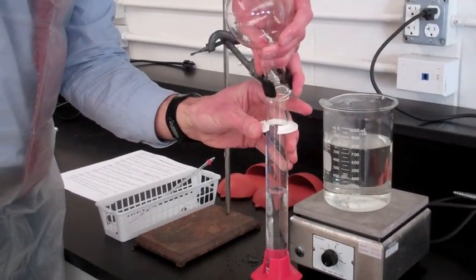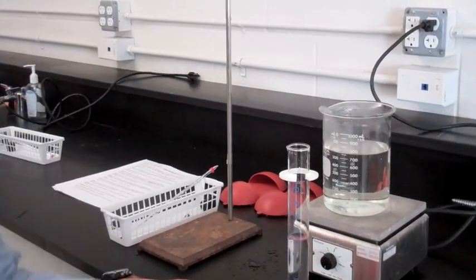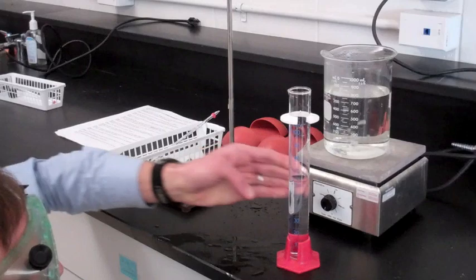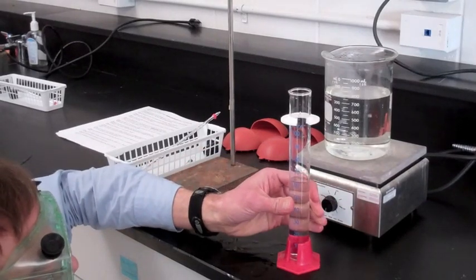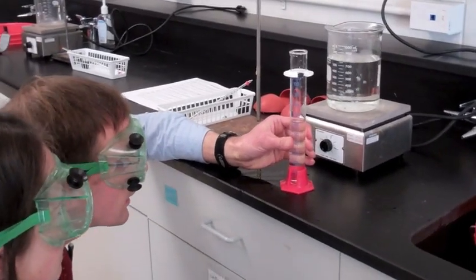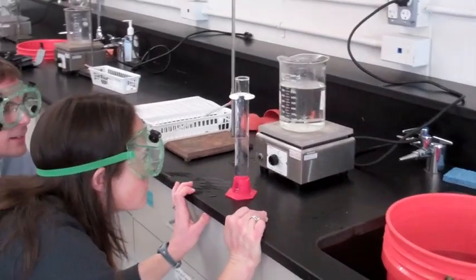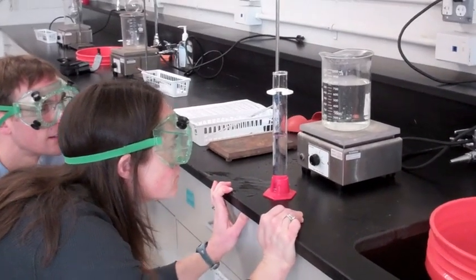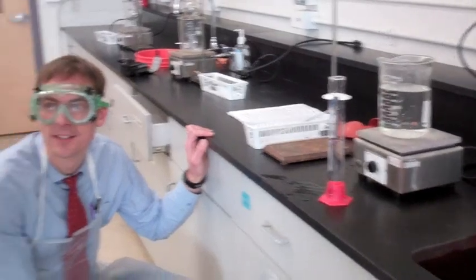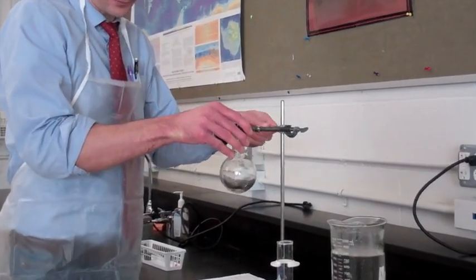We just want to be careful we don't spill any water, because if we spill the water, we've got to start again. Ms. Gardner, can you come and help confirm my reading on here? I'm going to make a reading, but I'm not going to tell you what it is. And you'll make a reading, and we'll make sure we agree. What did you get? I want to say it at the same time. 62.3. Hey, that's what I got. Nice!